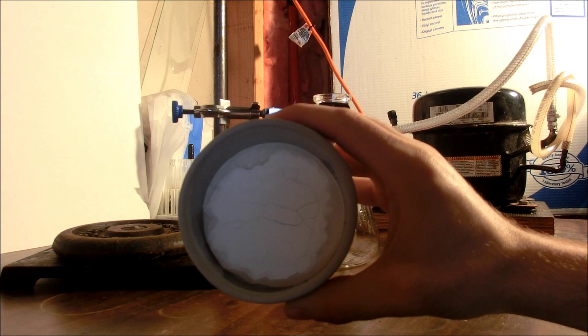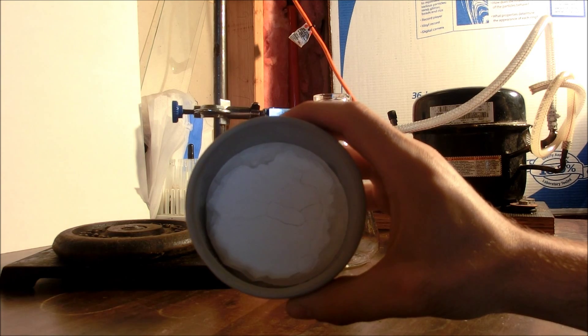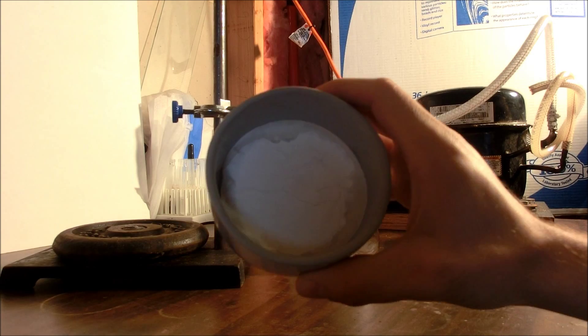After filtering, you should have a nice filter cake. I'm going to put this back on there and wash it several times with distilled water.